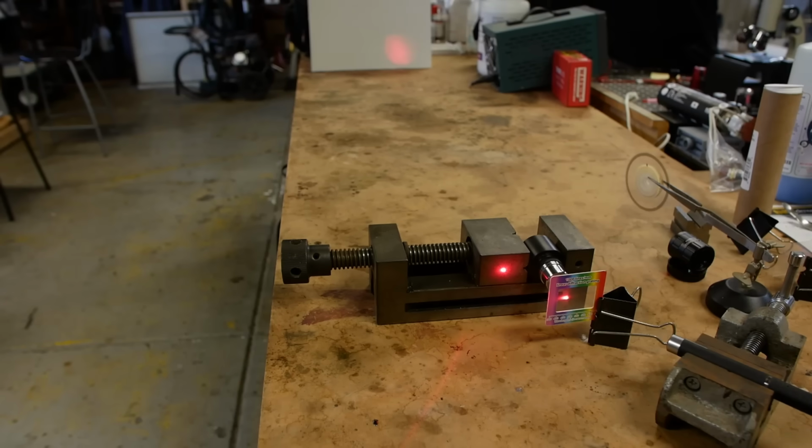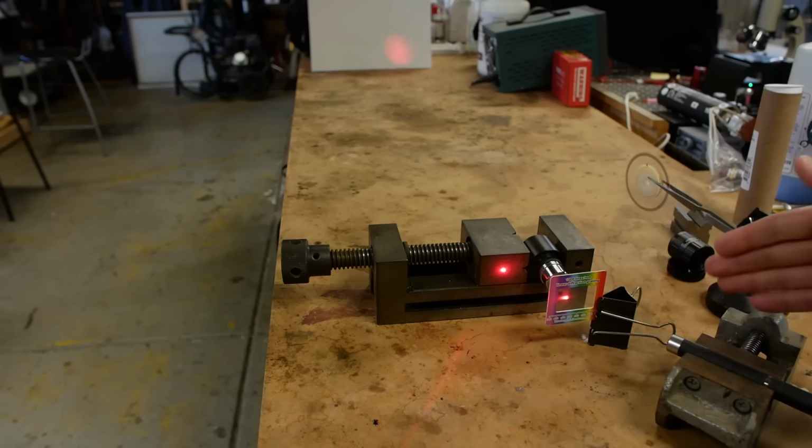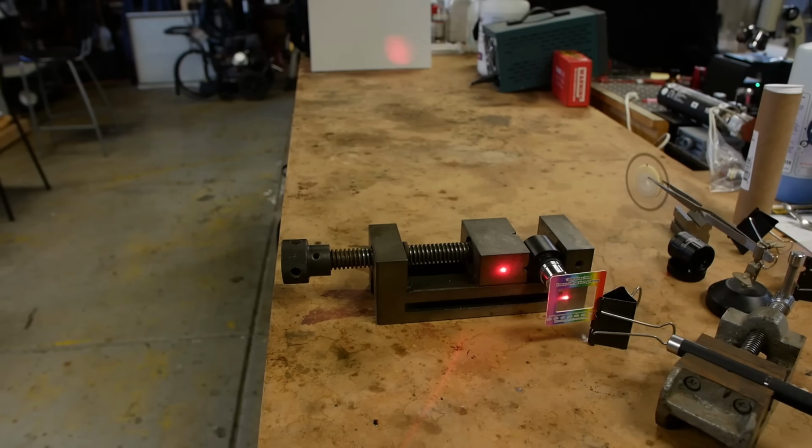So you can see how this would scale up to an actual slide of animal or plant cells. It's basically just a very complicated checkerboard where different parts of the image have different spatial frequencies, and we collect all those spatial frequencies by changing our illumination angle. So for every pixel in the image, we end up with several hundred spatial frequencies, and we look through all those spatial frequencies to figure out what the actual features are in that region of the image.